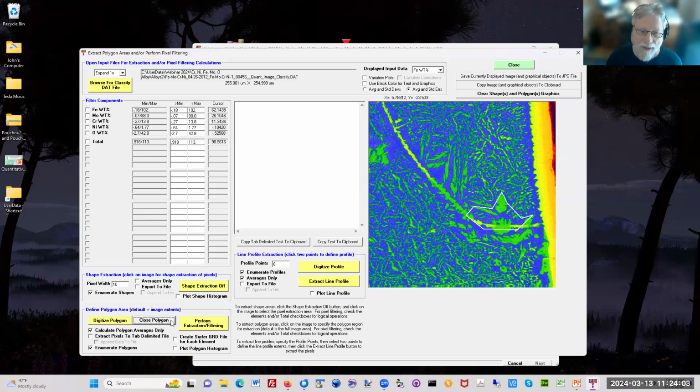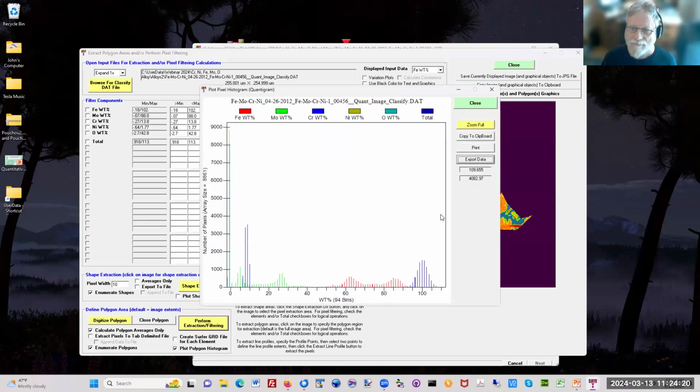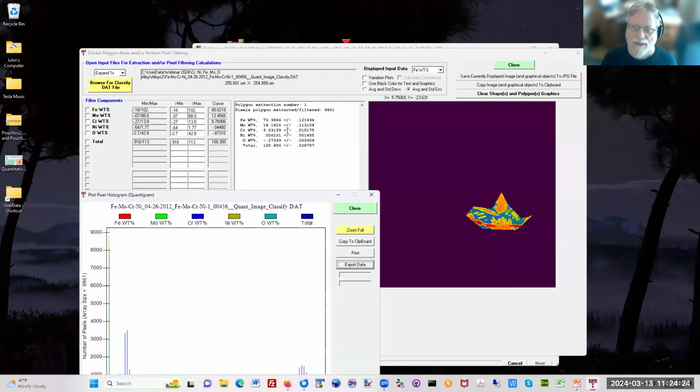Okay, I'm going to close that polygon. It'll close it automatically if you forget. And I'm going to plot the polygon histogram. So this is going to extract that. By the way, if you don't define a polygon, it uses the entire map, which takes a few minutes, so I don't want to do that right now. So here are two things. One is the composition of that area, with the variances. Here's the area defined.